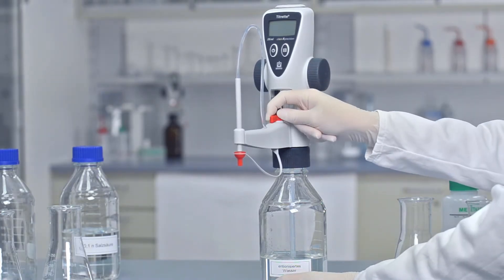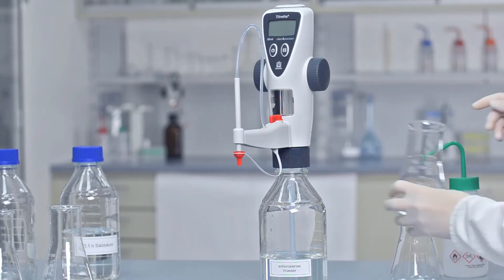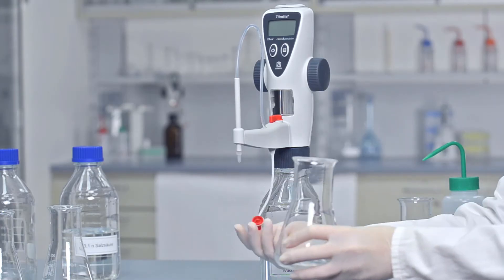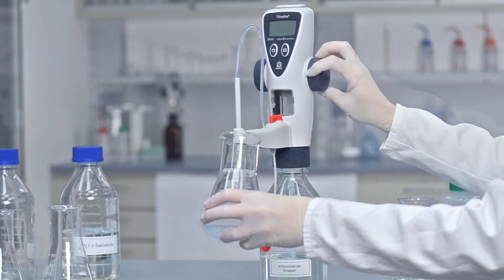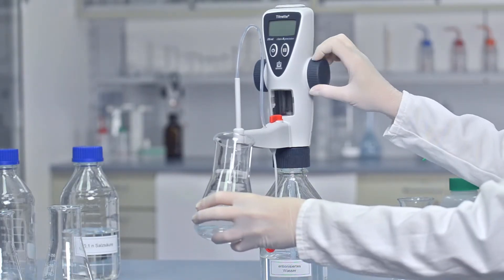To rinse the titrating tube, set the valve to titrate. Then fill the instrument completely several times, emptying it each time into a suitable receptacle.